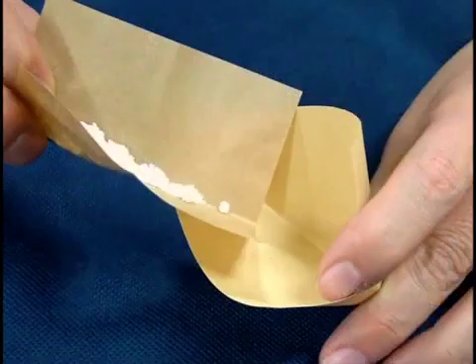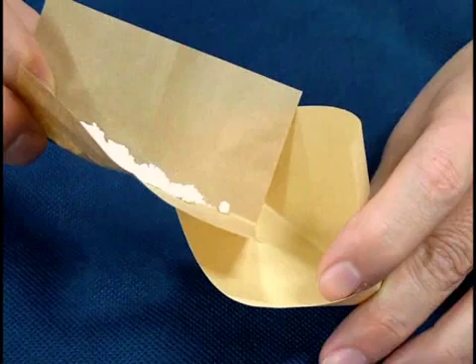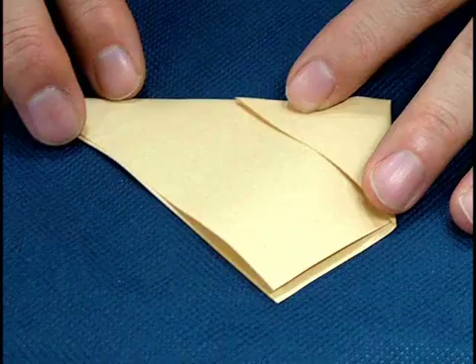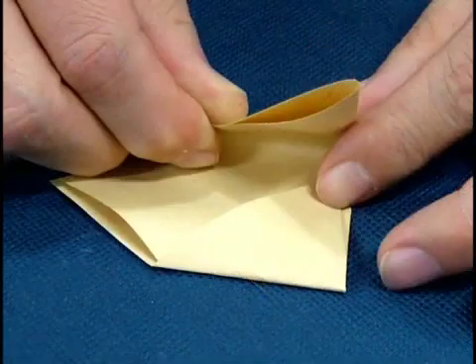Place the sample in and bring them onto the left side. Make a right fold to hold the sample inside the fold lines.